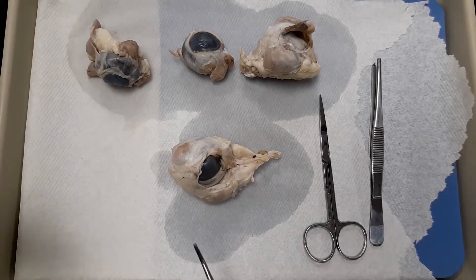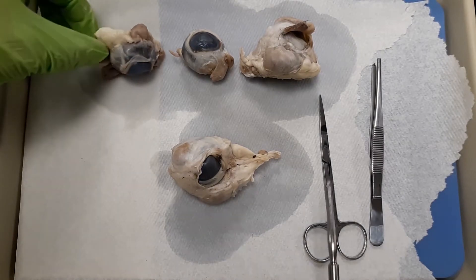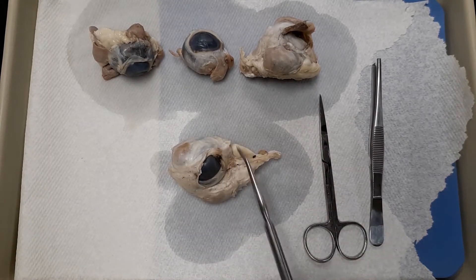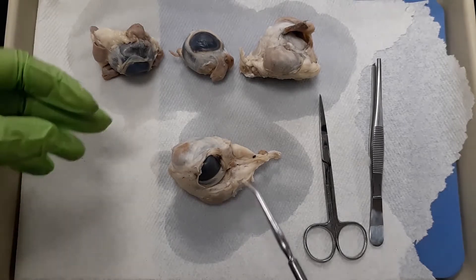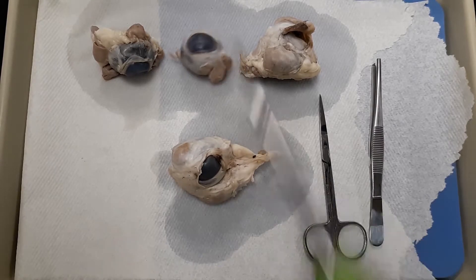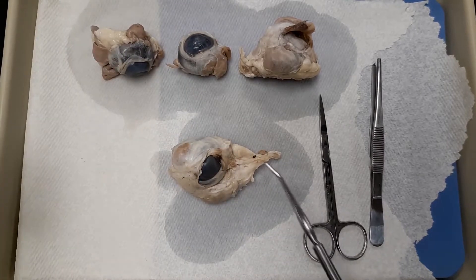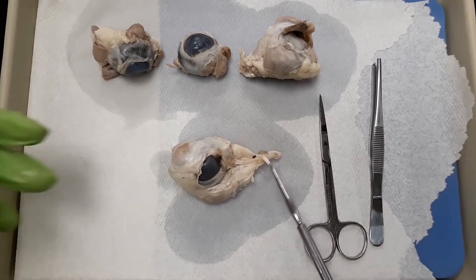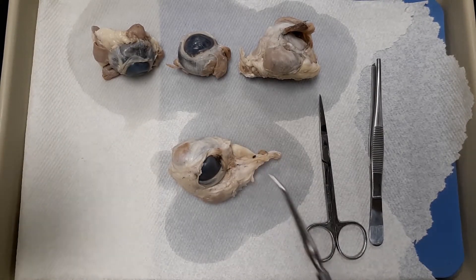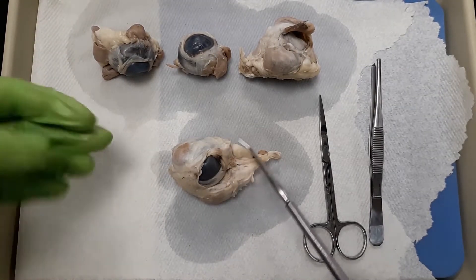In this video we're going to be filming how to dissect a sheep eye and we're going to be noting the different structures. Each of these three eyeballs kind of illustrates a structure best, and then we're going to actually dissect and remove off this eyeball. When we're dissecting an eye, our dream eye would look nice and skinny with everything mostly removed, but we tend to get eyes that have a lot of peripheral structures still on them. Your goal is to isolate everything really well and be able to name and identify structures as you go through.